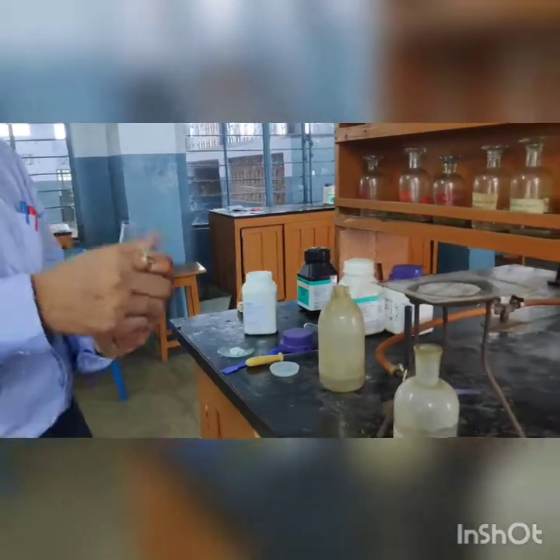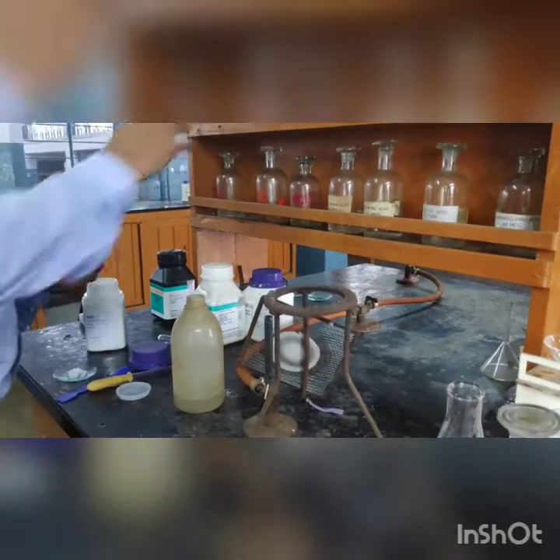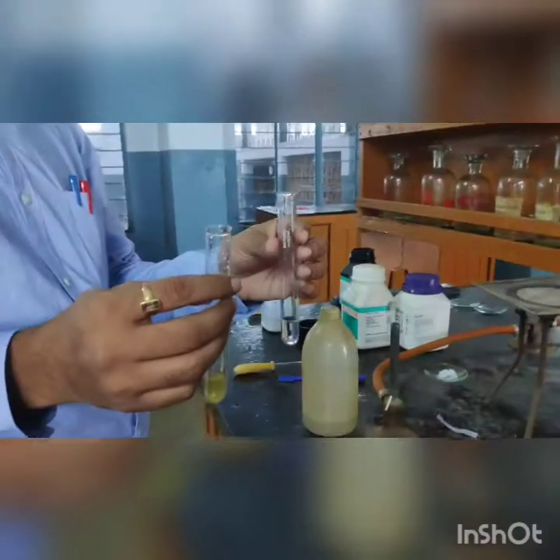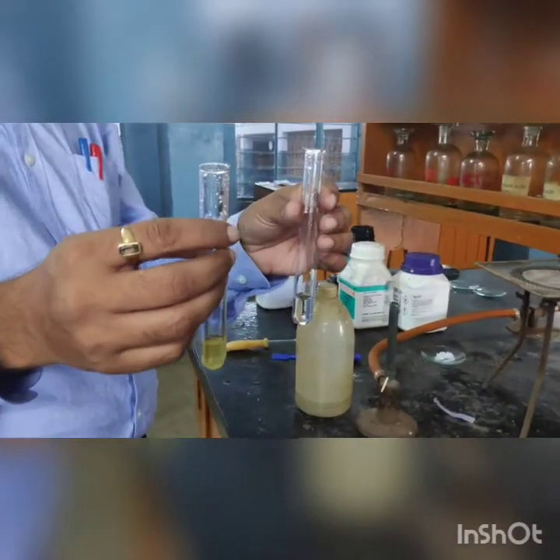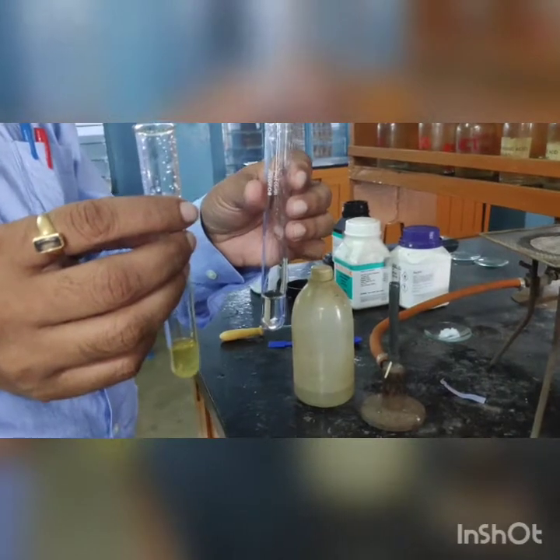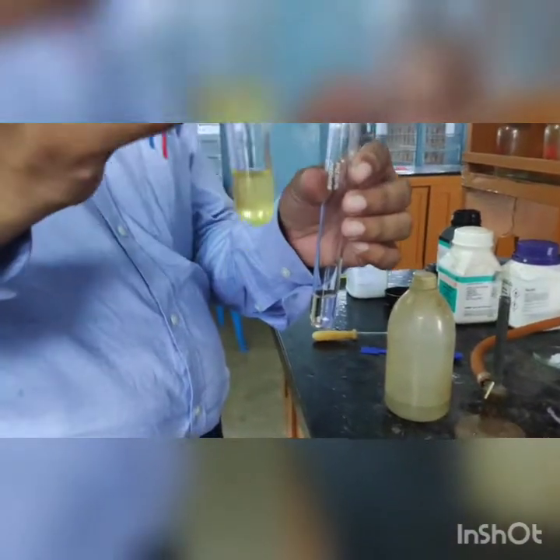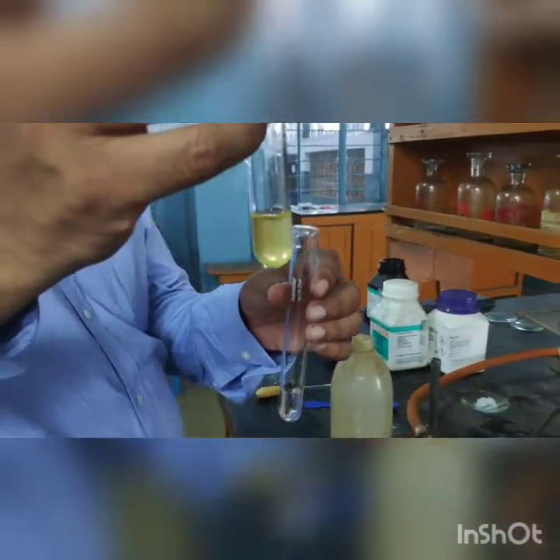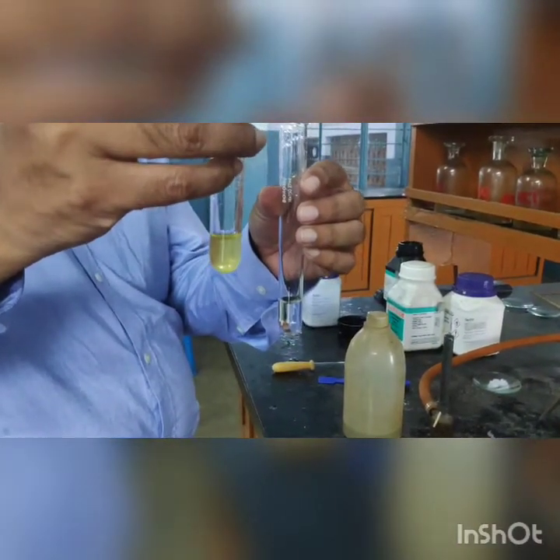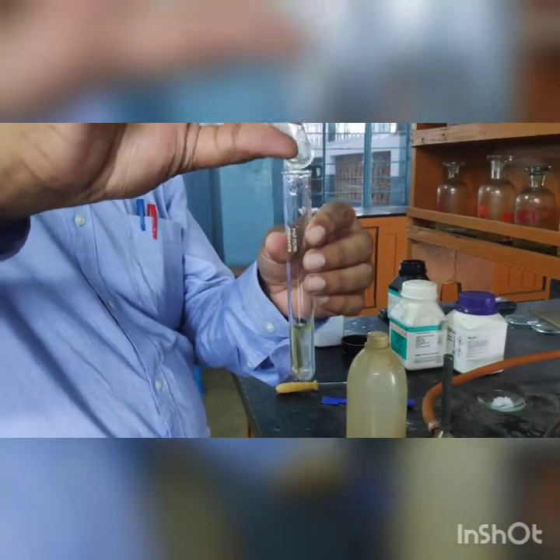In this video we are showing how to test the anions in a salt by preparing the sodium carbonate filtrate. Now we are going to test another salt — this time for the nitrate ion. The sodium carbonate filtrate has been acidified by an acid other than nitric acid, and to test for the nitrate ion we need freshly prepared ferrous sulfate solution.